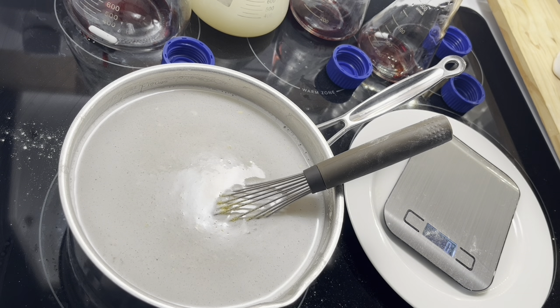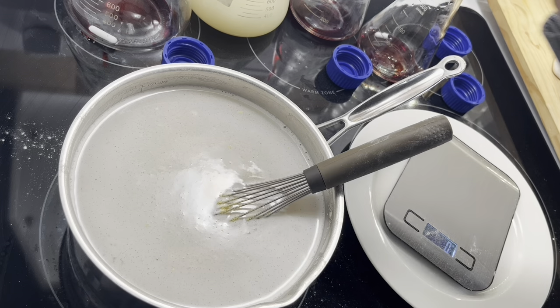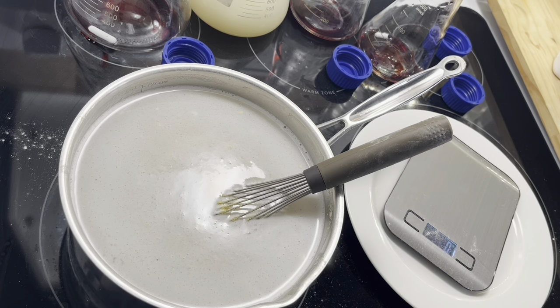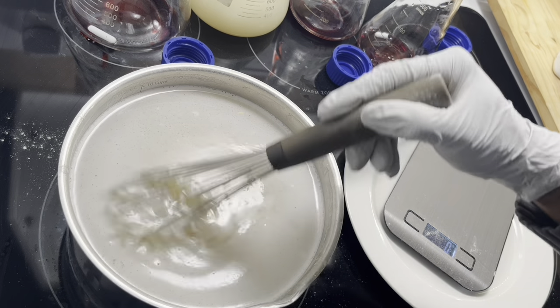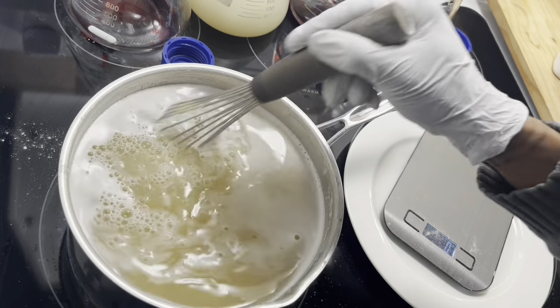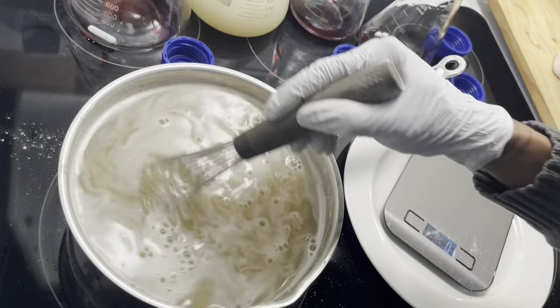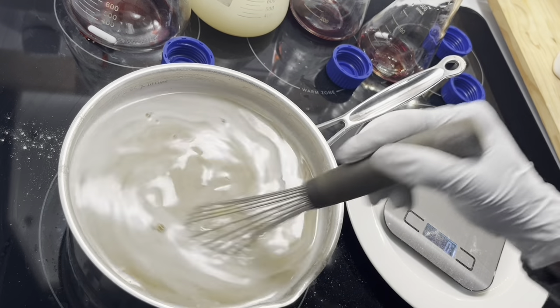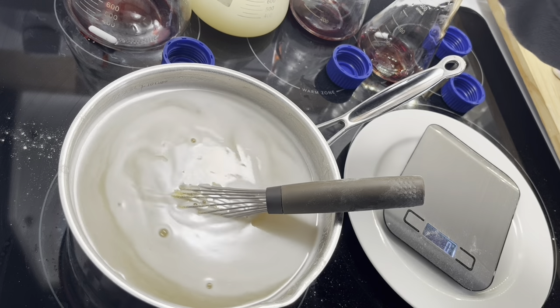I like to get a rich, dark color. That's the whole point — a nice rich dark color so you can see the contrast of the mycelium as it starts showing its true beauty. I'm going to get it set up to pour.